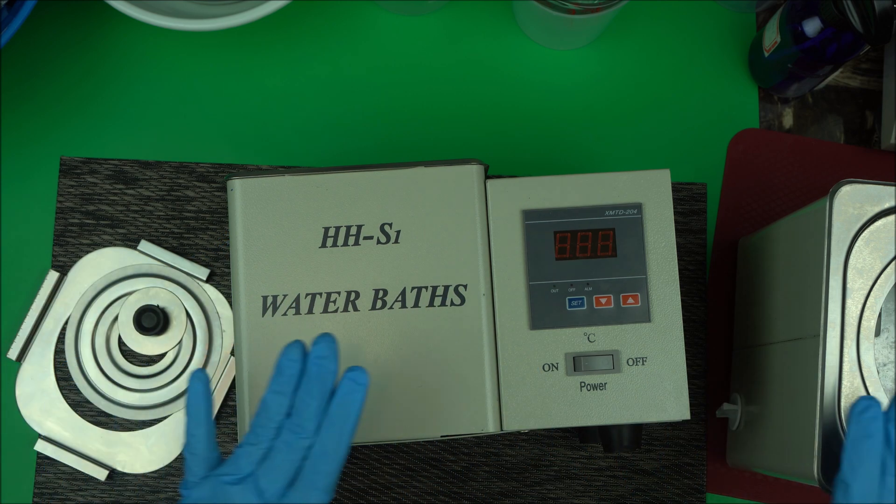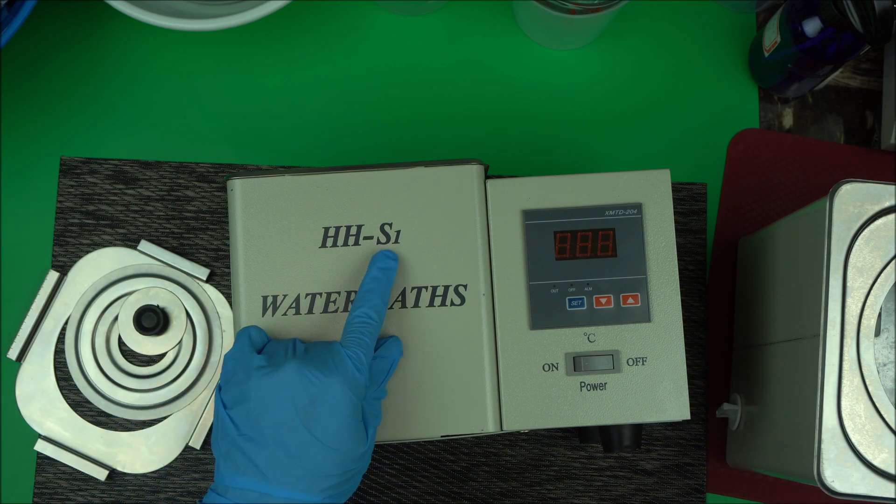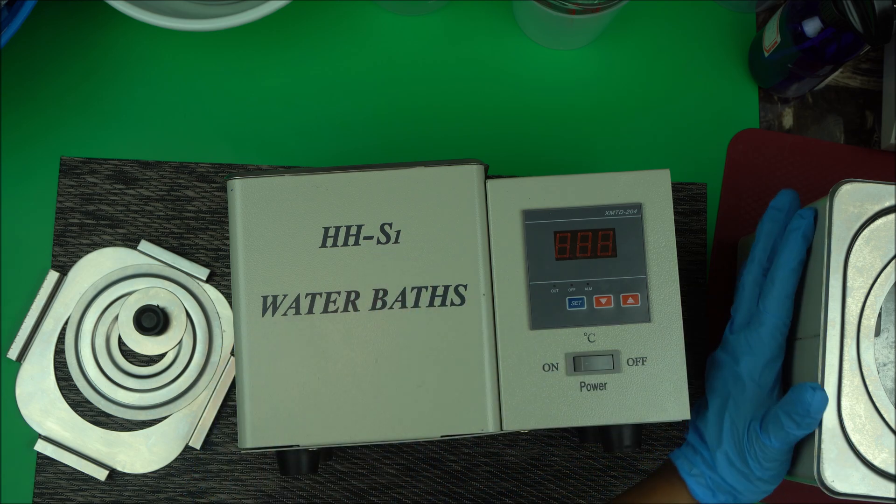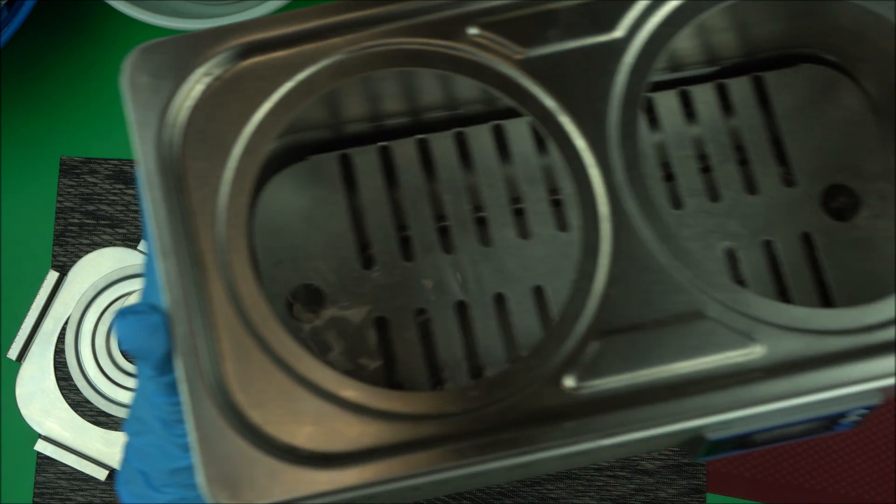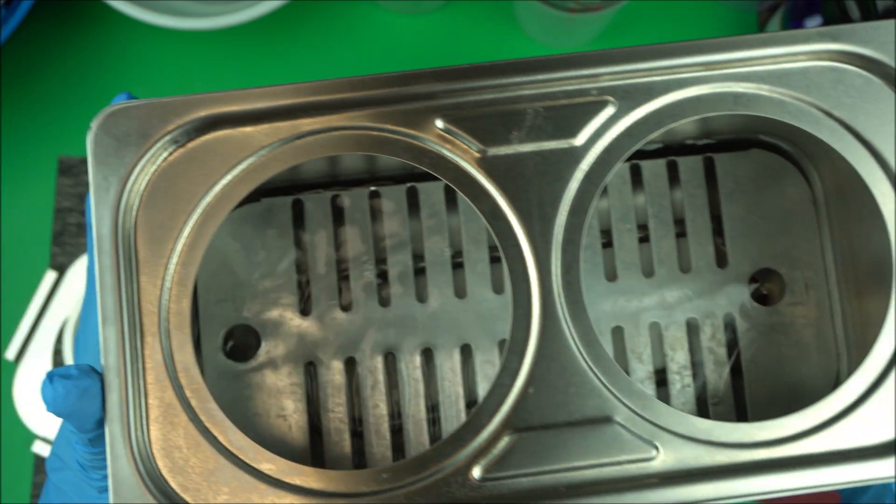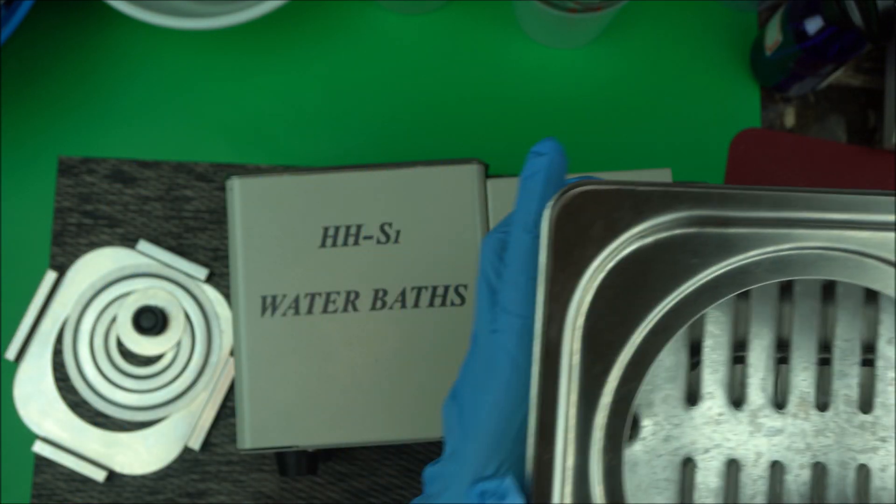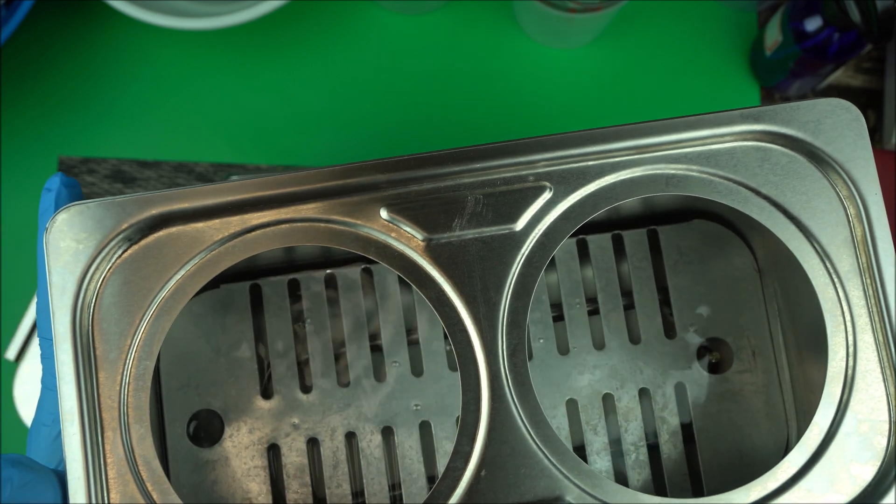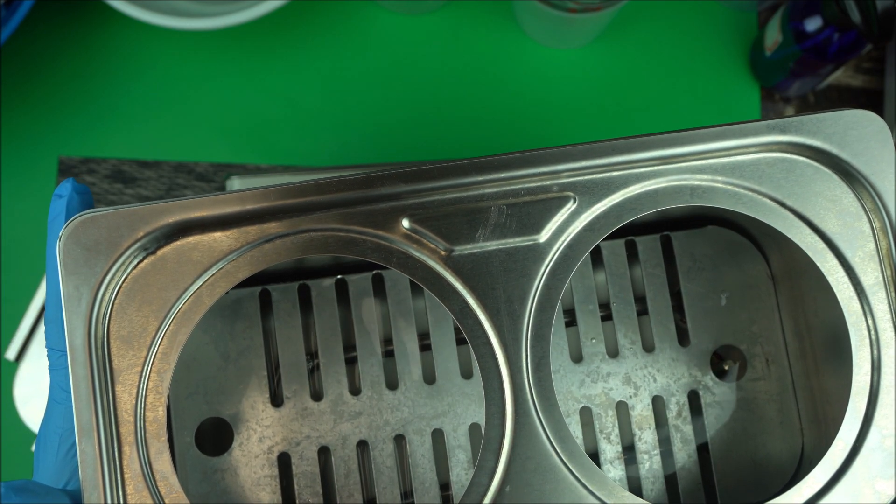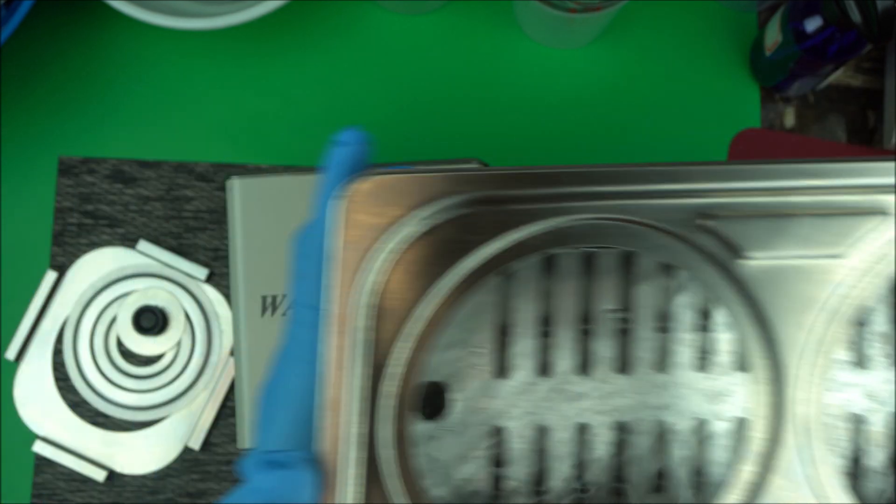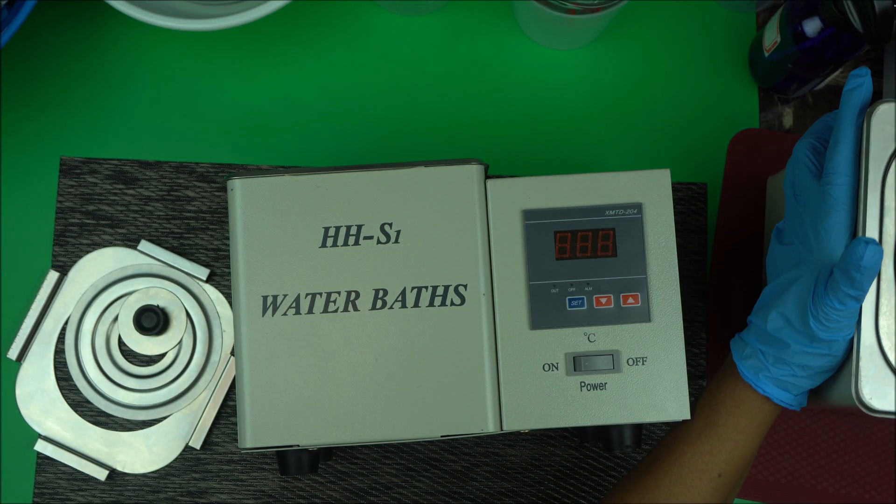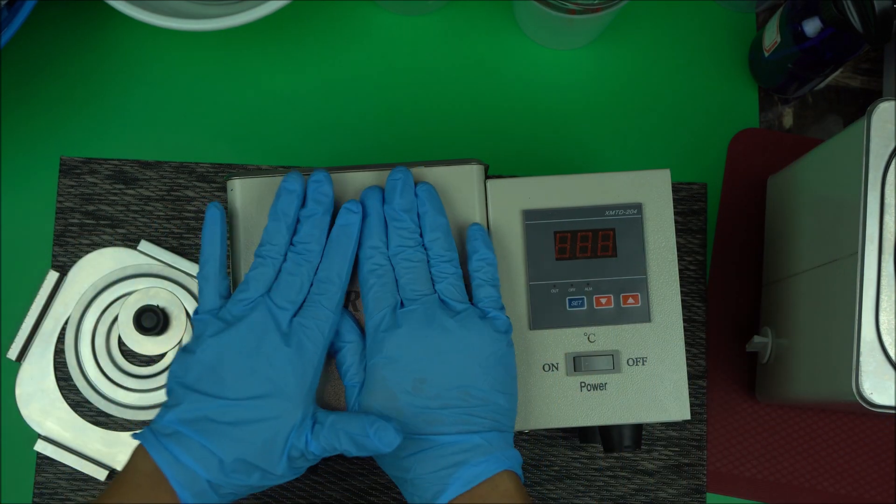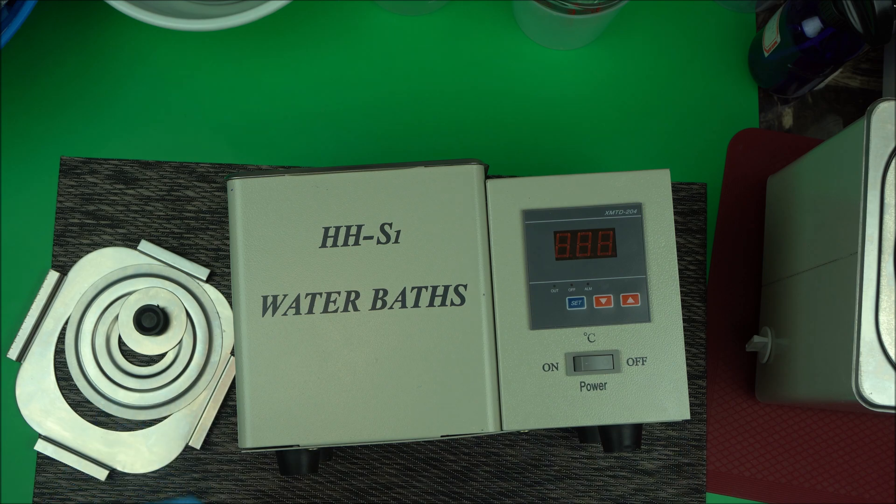I have different water baths here on my desk. I have the HH-S1 and also the HH-2, the bigger version. This is what I use for bigger formulations when I want to make up to 10 liters.